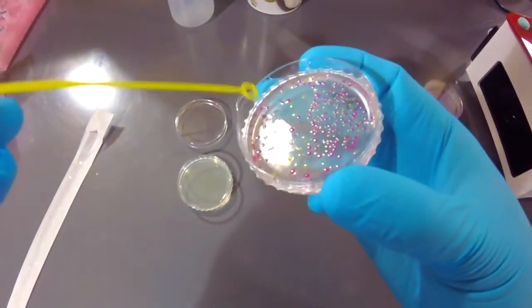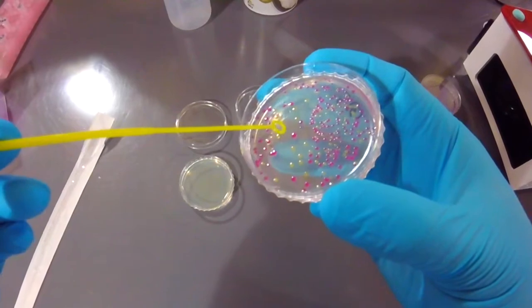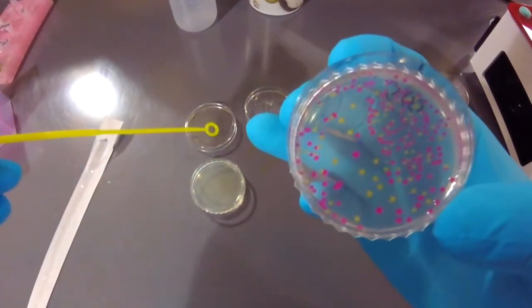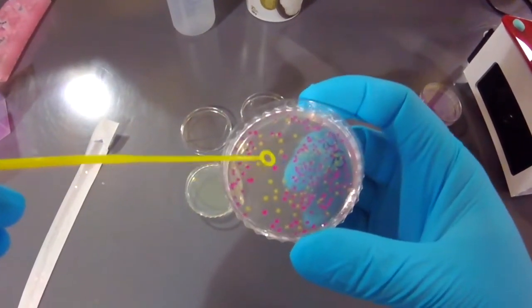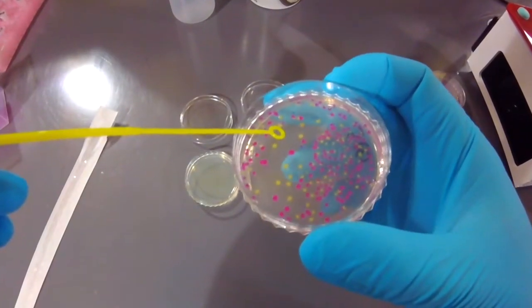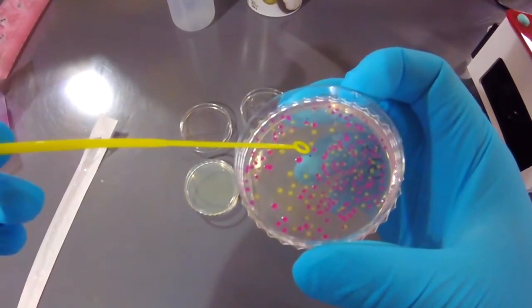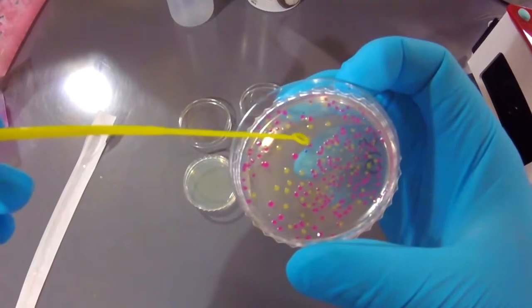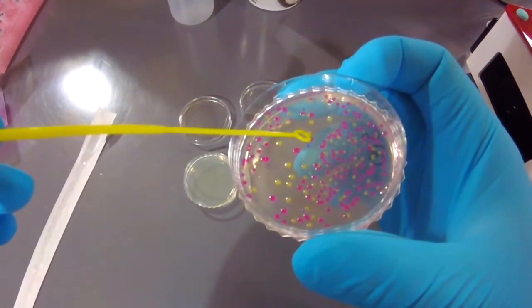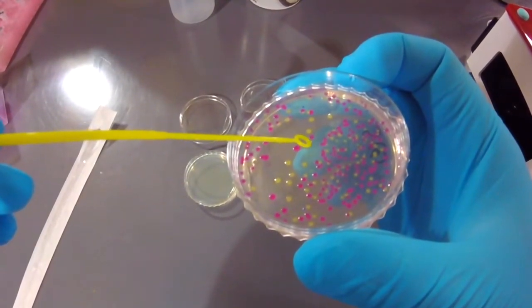Okay, so the important thing is that you make sure you only get the tip, the top of the loop, touching the bacteria. So I'm going to go ahead and do this, let's do this blue one here. So I'm just going to just touch it.